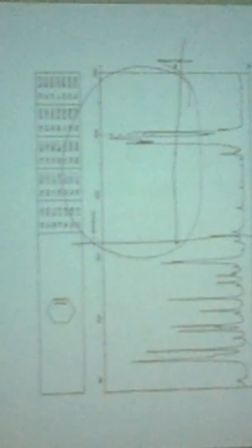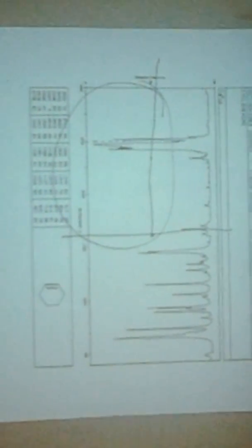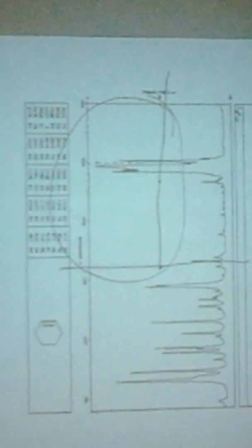Now from cyclohexane, we'll go to cyclohexene. We box off that quadrant where you're supposed to look. You see that just to the right of that imaginary 3,000 reciprocal centimeter line, you see the same saturated CH that we saw with cyclohexane. And we should, because cyclohexene still has plenty of saturated CH.